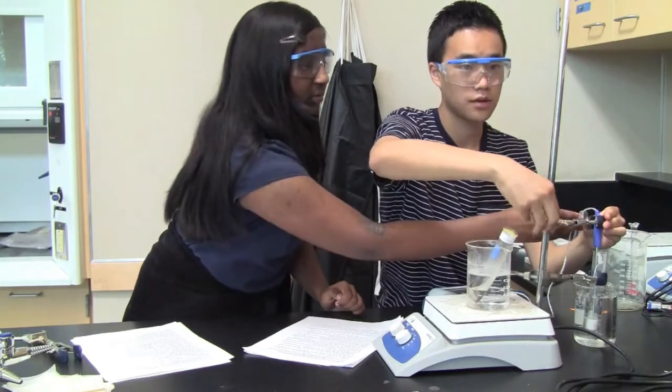And once it has turned solid, you don't want to remove the temperature probe yet because the temperature probe has some lauric acid on it. Plus it might be stuck there. You never know. You want to be safe. You might just have bad luck.